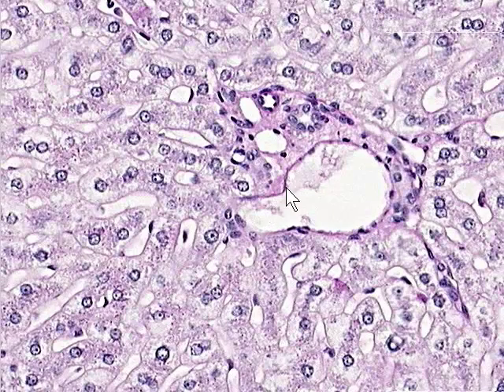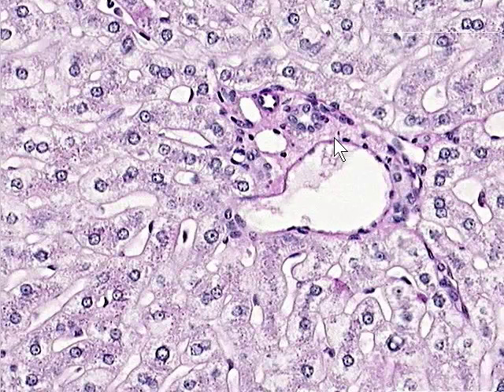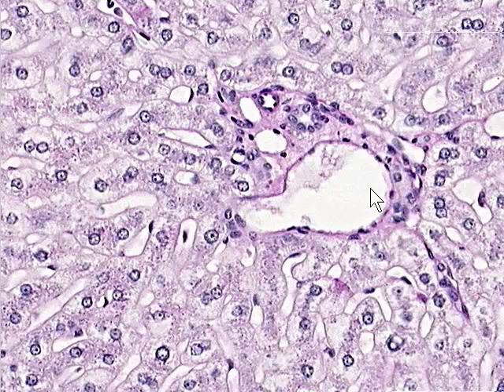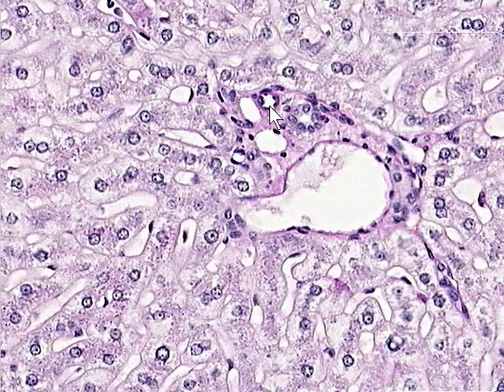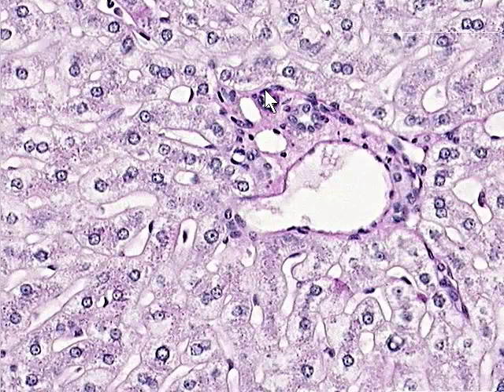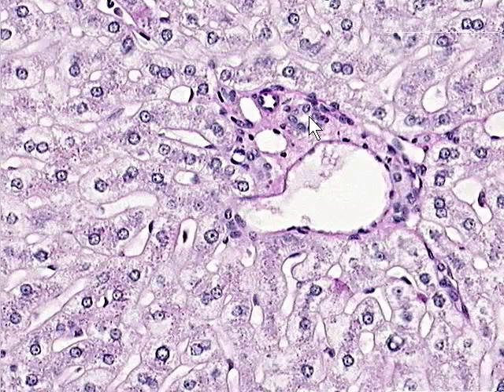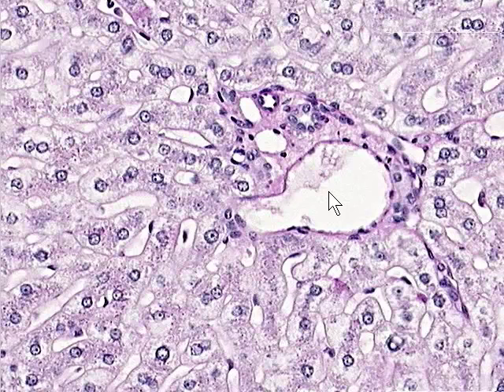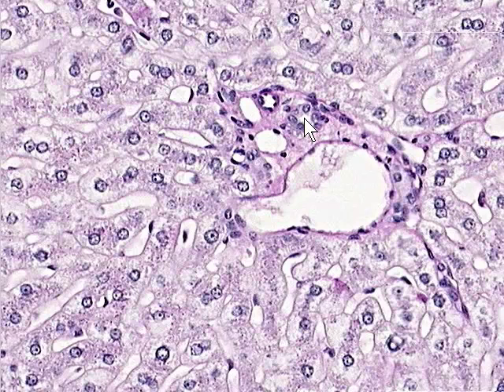Here we're on 20x magnification. This very large vessel lined by simple squamous endothelium with no other wall structure is a branch of the portal vein — a portal venule. Accompanying the portal venule, we would expect to find a branch of a hepatic artery, a hepatic arteriole, and indeed here is the hepatic arteriole: simple squamous endothelial cells lining a lumen with just one layer of smooth muscle surrounding it. This structure here, a very small lumen lined by simple cuboidal epithelium, is a bile ductule. The portal venule carries portal blood to the lobule, the arteriole carries arterial blood, and the bile ductule carries bile away from the lobule.